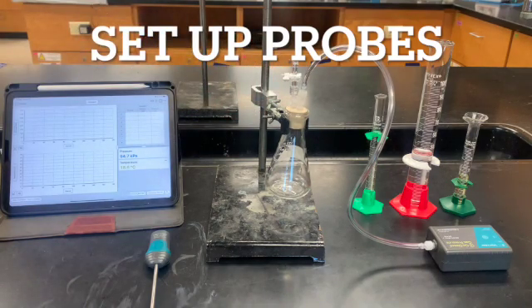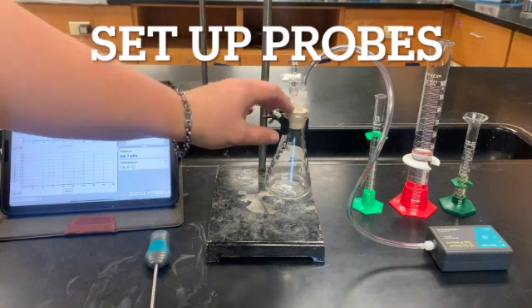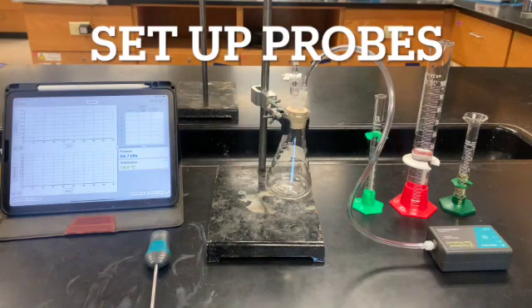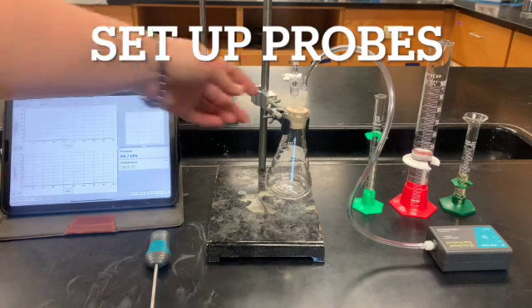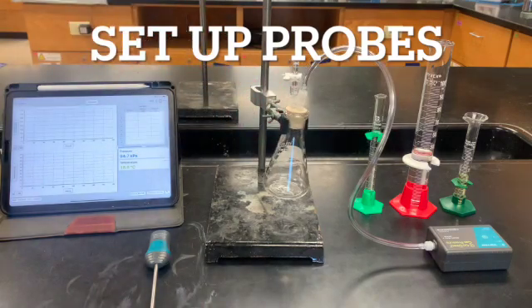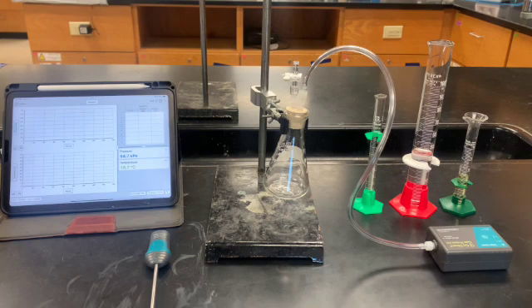All right. I'm using a 125 milliliter Erlenmeyer flask. I'm going to make sure that this fits well in there. We're going to talk about how you take that off and put it in there, and if you do it right, you can actually just shake, and that'll work just fine. If you want to get a little fancier, you can get the magnetic stirrers and magnetically stir it. So we've got it all set up, and now we're going to follow the instructions.